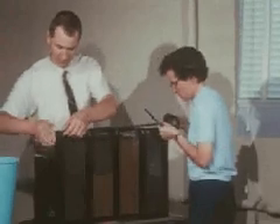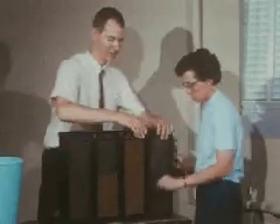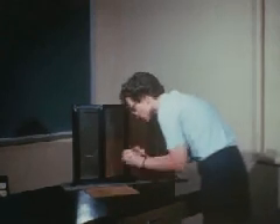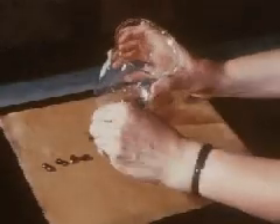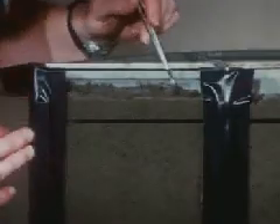Once the compartments are filled with prepared soils, the box is sealed so that soil water content remains constant. The seeds are germinated before planting. The cotton seed used in most of the experiments is especially inbred for maximum uniformity. Since cotton puts down a large tap root before the cotyledons emerge, these seeds provide the growing root with a relatively constant food source. Pre-germinated seeds with a hypocotyl about one millimeter long are selected to further ensure uniformity.